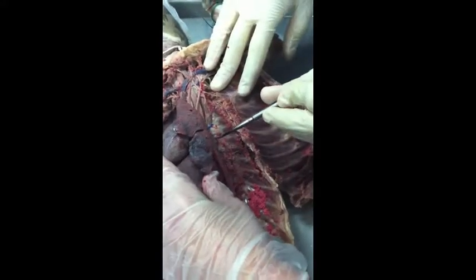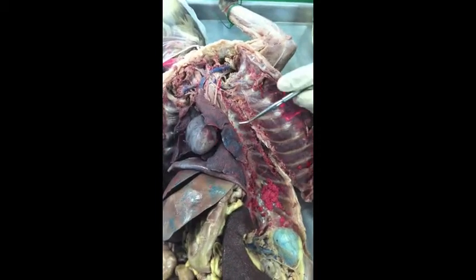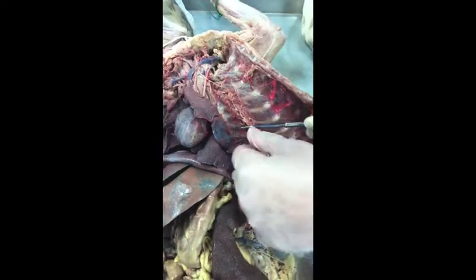Maybe that's some of it here. I don't really see much left of it though. It's pretty easy to clean up. You're gonna ask that? If I have a good looking one, I will. Is it gonna be nice, bright and yellow? It'll be so perfect. You'll know exactly what I'm looking for.